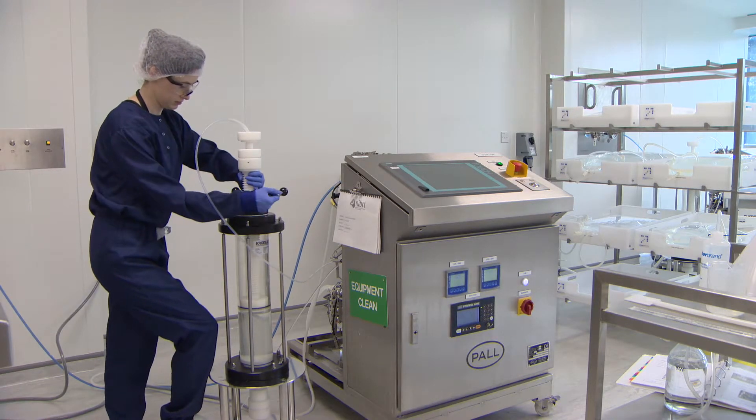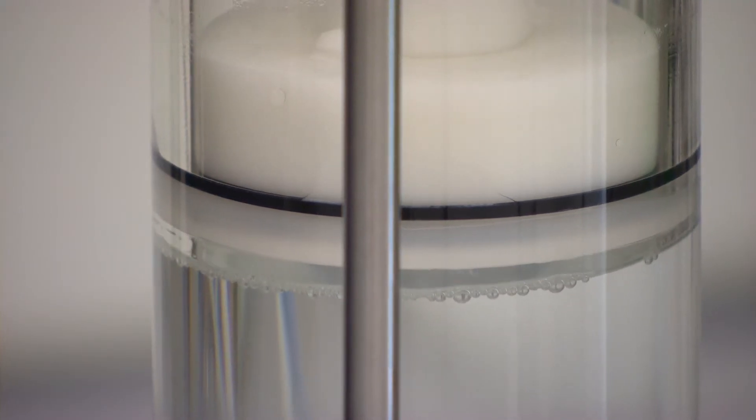It is then lowered further still such that any air trapped within the bed support matrix is pushed upwards and out through the top bed support by the liquid within the column.